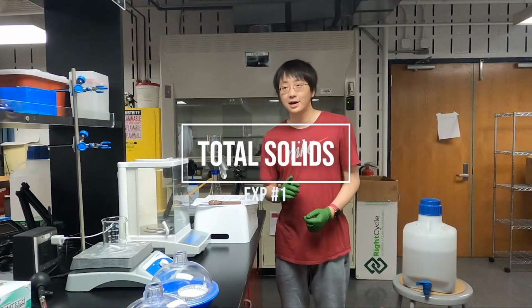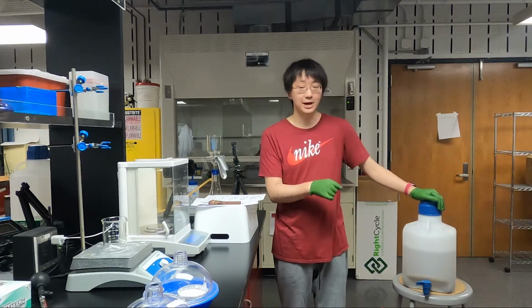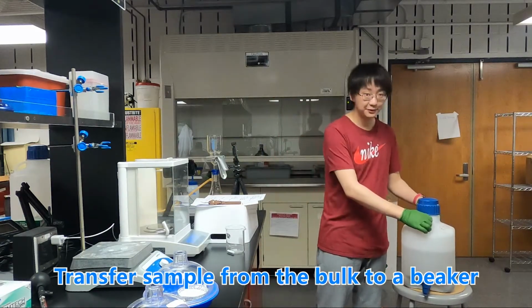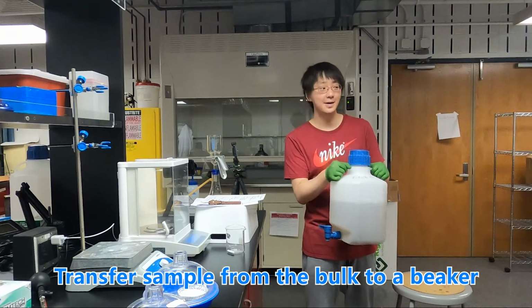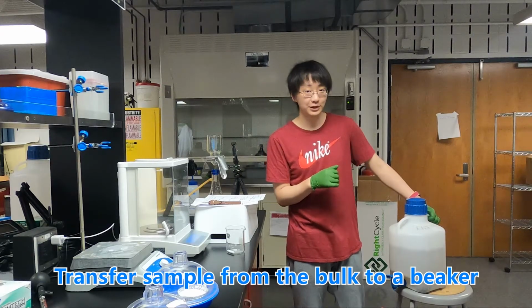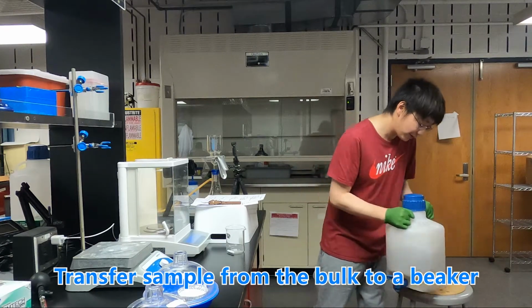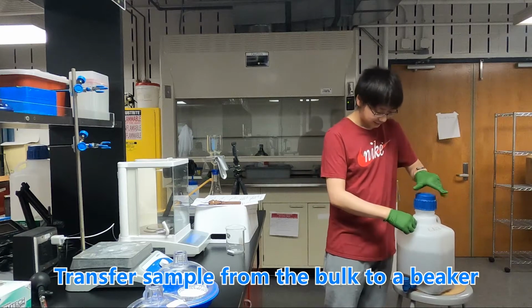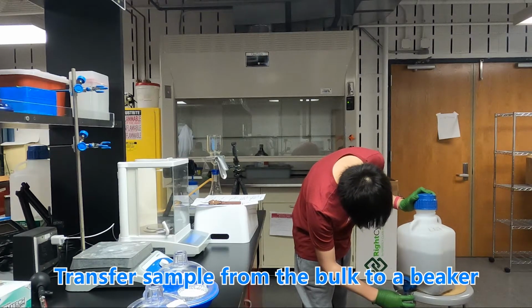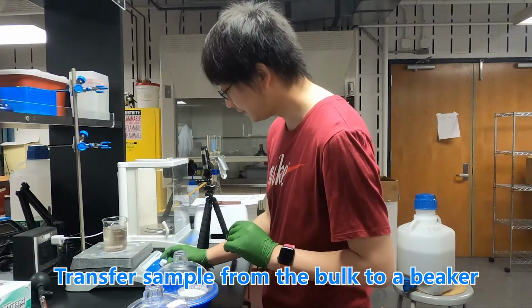Now let's do the first experiment, total solids. Before we do experiments, we need to transfer some of the wastewater samples into the beaker. So first, this is the wastewater sample. And before we take the samples from this big bottle, we need to shake it to make sure the wastewater sample is mixed and representative. So we need to mix it first and then get some samples. And then we need to make sure it is well mixed in the beaker.